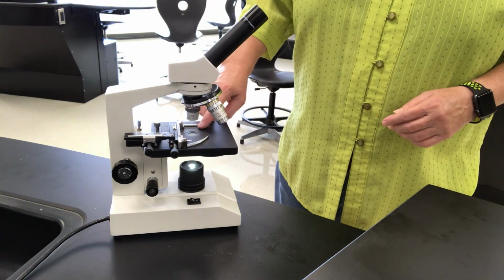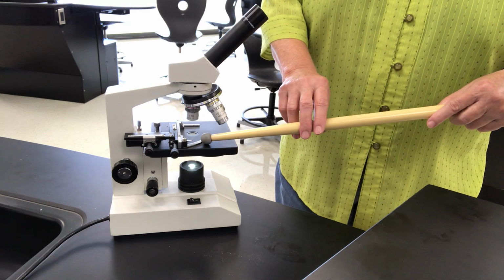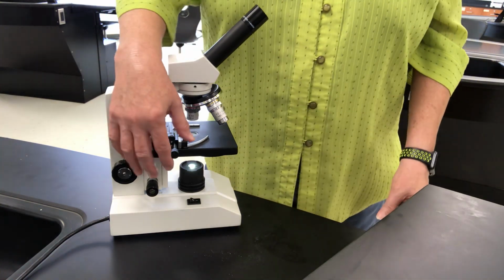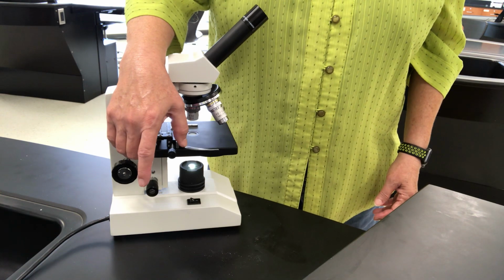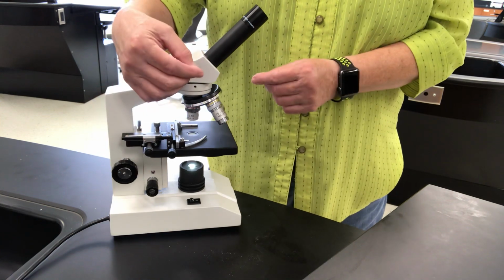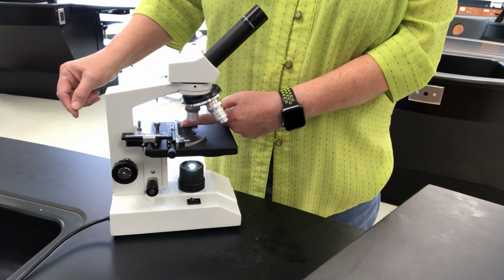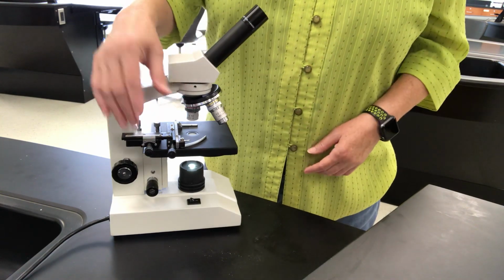What you have here at school, these are mechanical stages, okay? This is called a mechanical stage. You see it has numerous little silver things that are in various orientations. That's because when you are looking at a slide, this actually swings out like this. These are not stage clips. You do not raise them up and put a slide under them. You just swing that out. The slide would fit in that notch back there, and as it fits right there, you gently let go of that and it compresses it in there, okay?